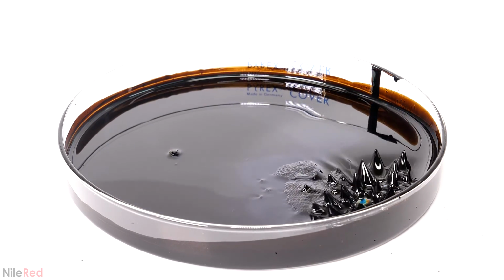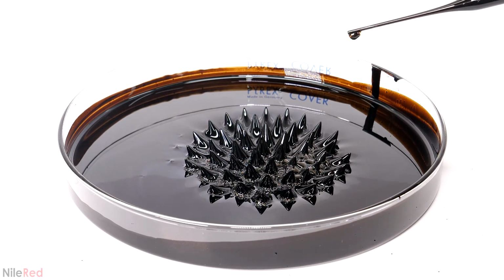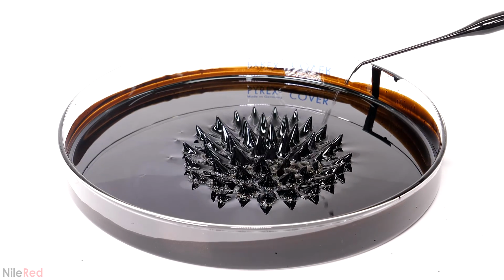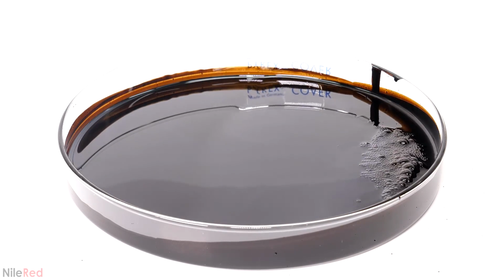Sometimes it initially works and it kind of looks like a ferrofluid, but then over the course of a day, it usually either separates or solidifies. Most of the time, those batches just end up being garbage, but sometimes they do end up being MR fluids, which, like I said, can be interesting in their own way.